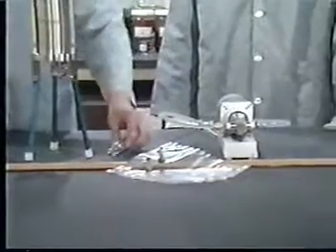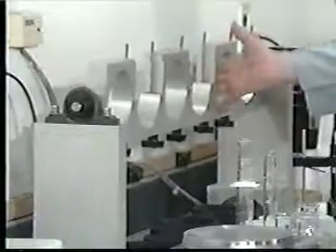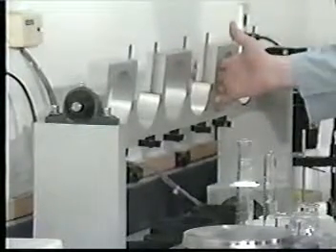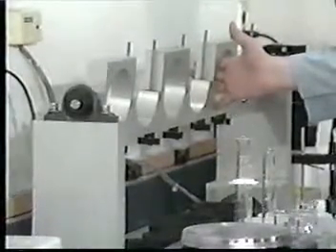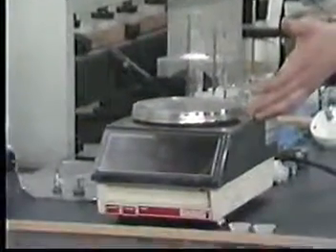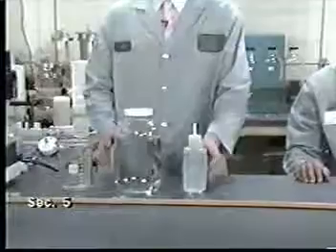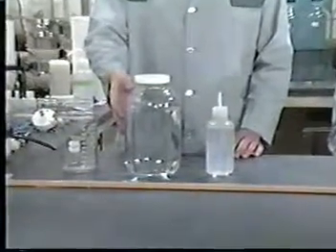A fluid transfer pump. The agitator, with which to rotate the extraction vessel in an end-over-end fashion at 30 plus or minus 2 RPM, and a typical laboratory balance, accurate to within 1/100th of a gram. We have on hand all the reagents which will be used to perform the TCLP. The reagent water has been monitored for impurities, and the other fluids are checked frequently to ensure their integrity.